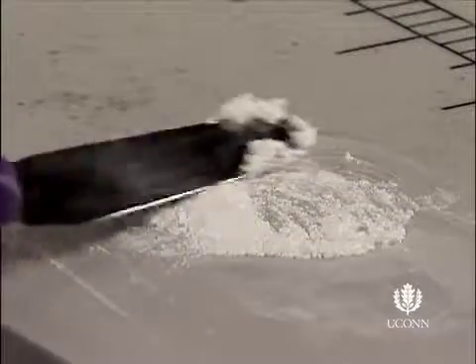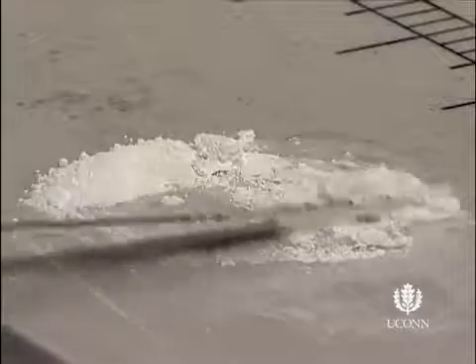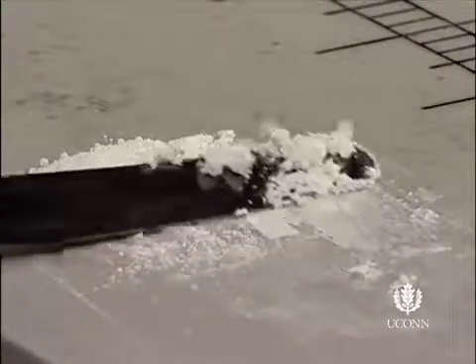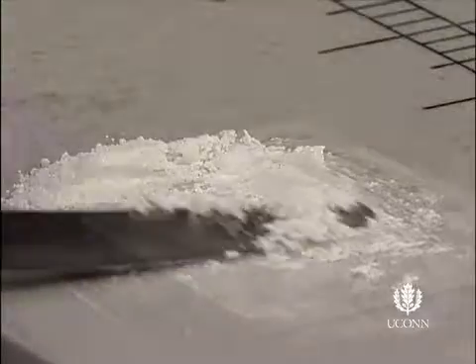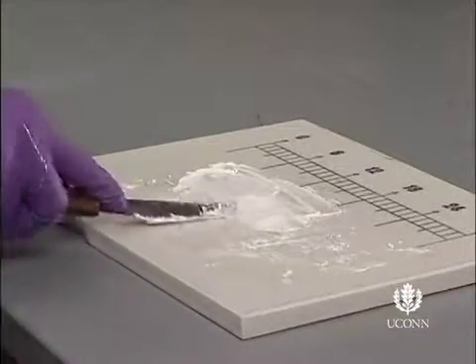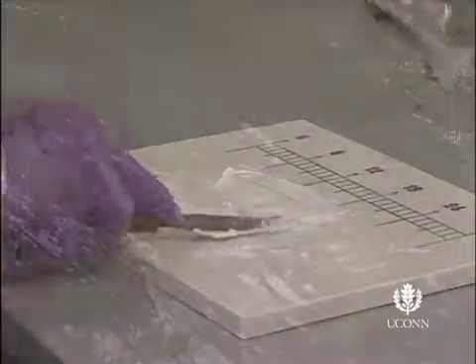A liquid polyethylene glycol works well for aqueous and oil and water emulsion bases, while mineral oil works better for oleaginous or water and oil bases. Simply put, levigating agents make incorporating solids easier, and they usually yield smoother, more homogeneous products.